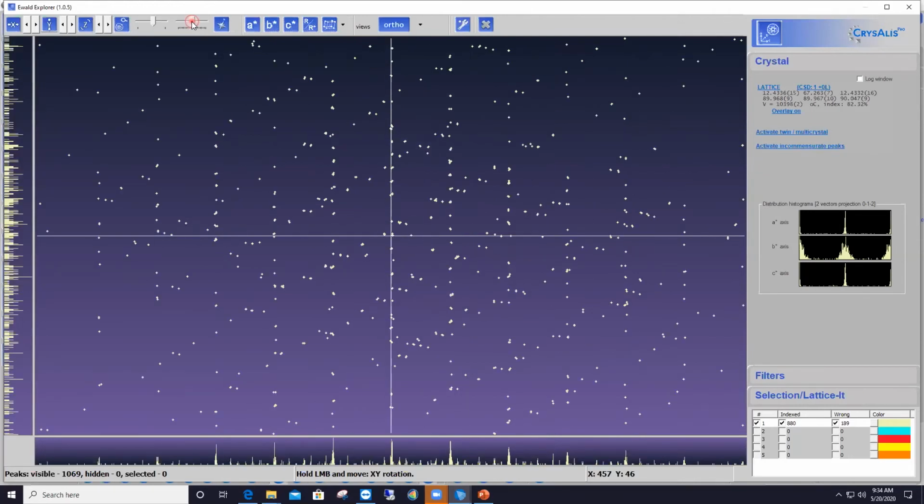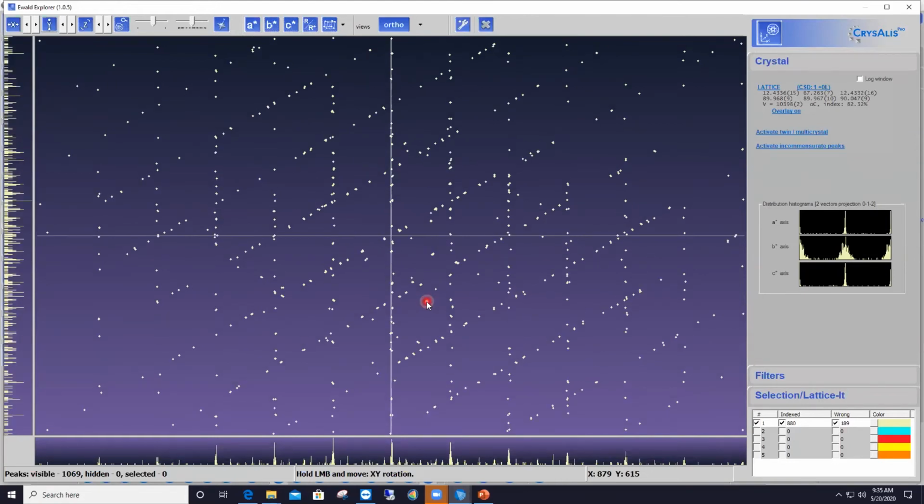If I keep going, here is one, for instance, that illustrates exactly what I wanted to see. There are vertical rows of reflections here and oblique ones. Now I can take my left mouse and rotate around a little bit more to see if I can align these rows a little bit better. So here I've got it even better aligned. I mean, the oblique rows of reflections are even better aligned. So this is what I meant when I said that I was looking for an orientation that would show me intertwined rows of reflections. So you have clearly two diffraction patterns here. Those rows of reflections crossing each other can never happen if you have a proper single crystal.